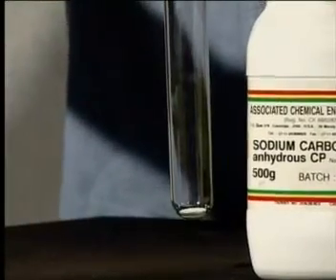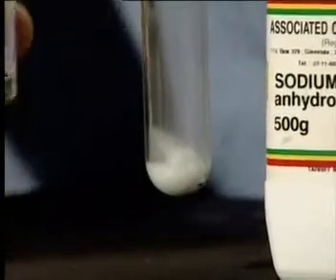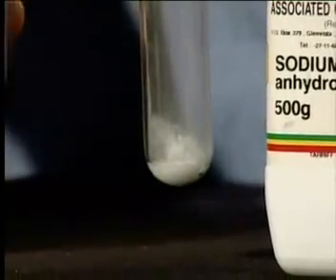Watch as we add a small quantity of dilute hydrochloric acid to a small sample of sodium carbonate powder. Did you notice that the powder reacted vigorously with lots of fizzing and bubbling? Now, what do you think caused the fizzing and bubbling to occur inside the test tube? Well, if you said it was a gas, you'd be correct.